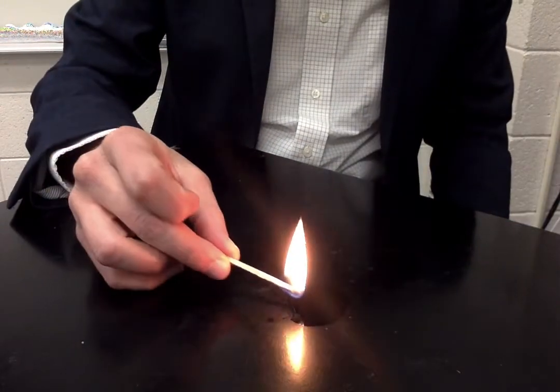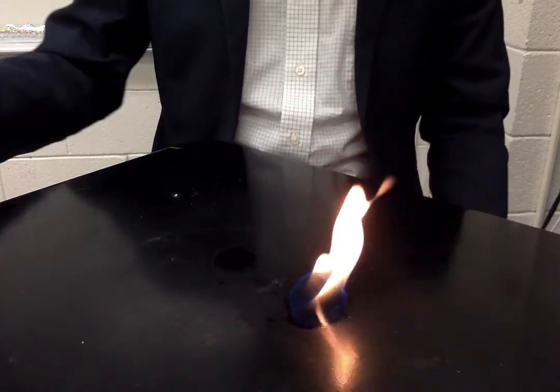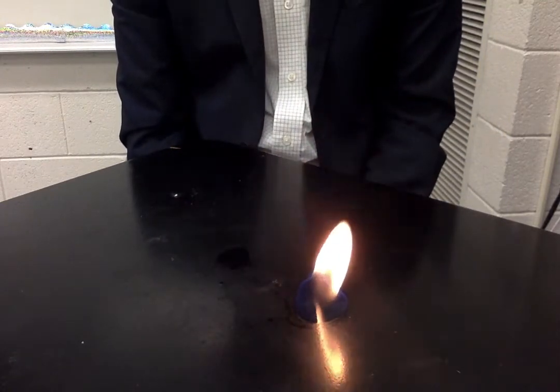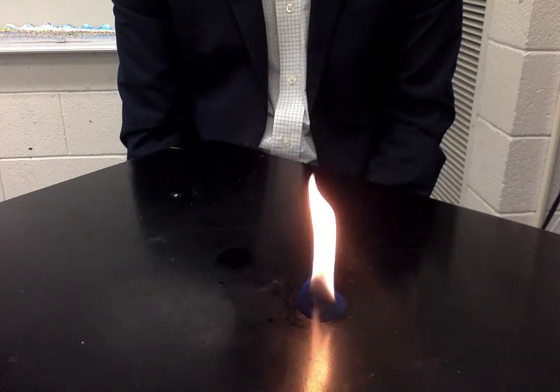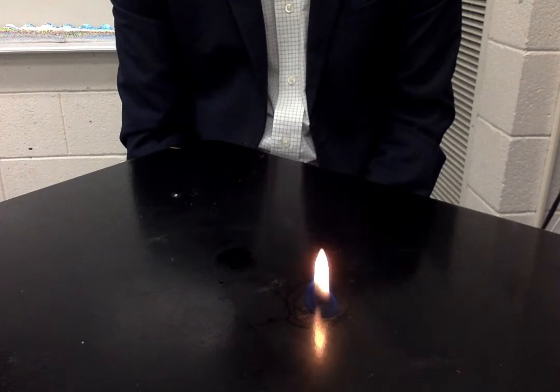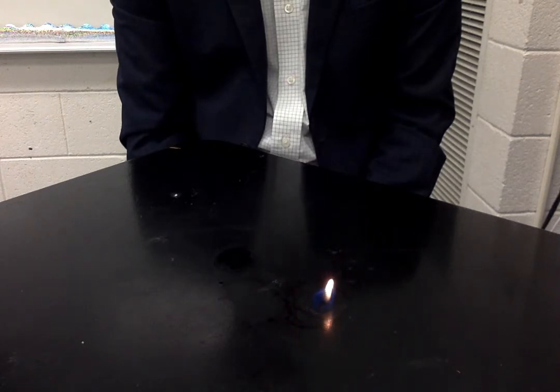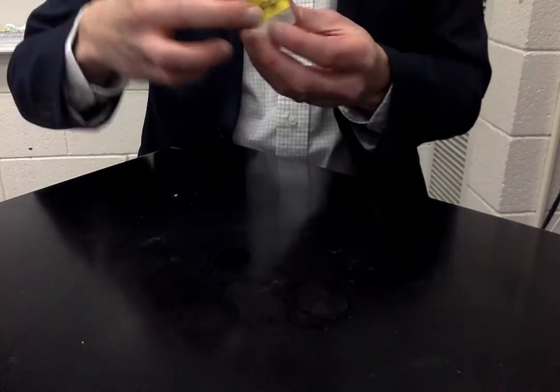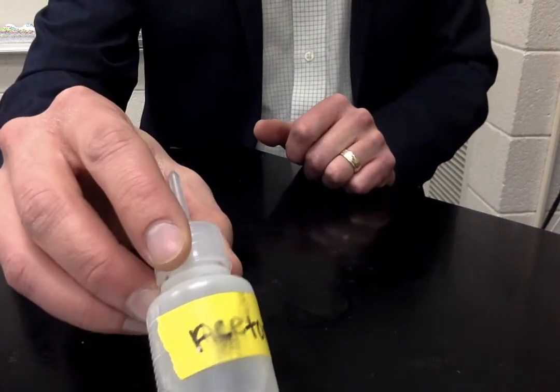Just about started myself on fire there. Quite a lot different than methanol. Letter D is called acetone. Acetone.